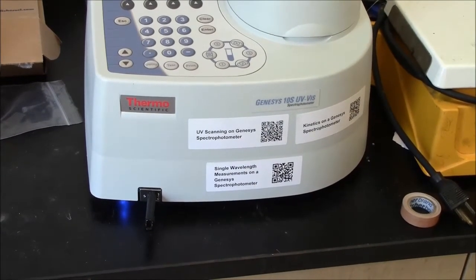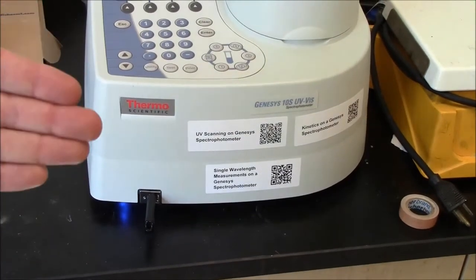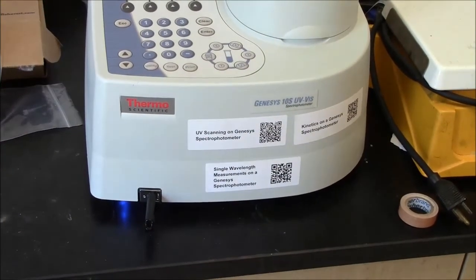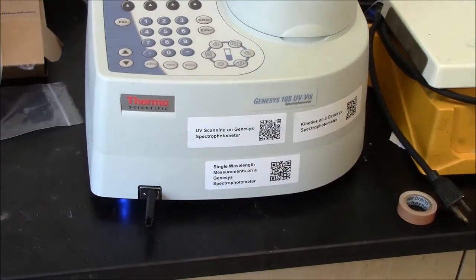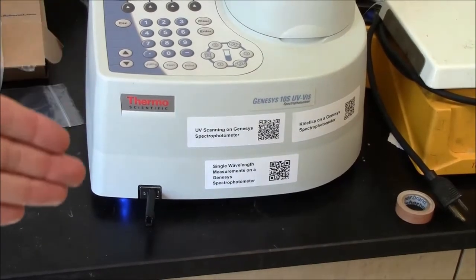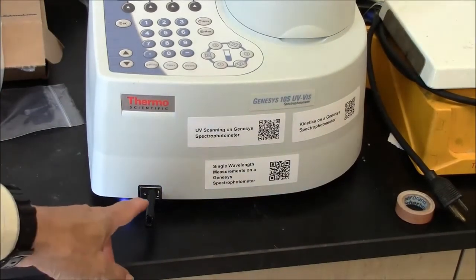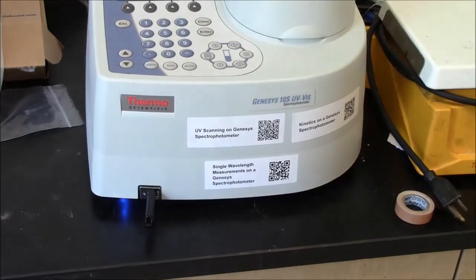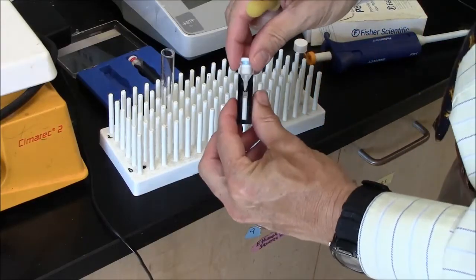You can also combine graphs of subsequent UV scans in this way. So you could say I scanned three different samples and I want to put them all in the same graph. This is easy to do if you use the data here. I'm done acquiring my spectrum.